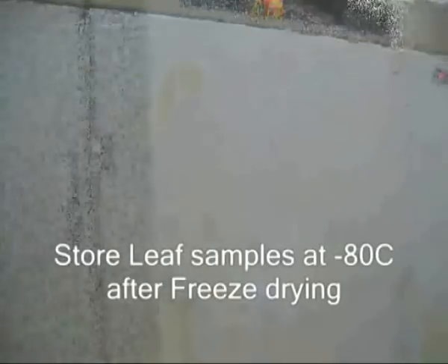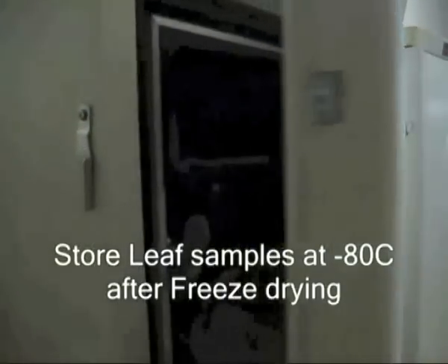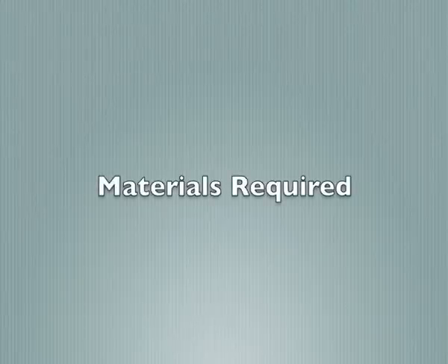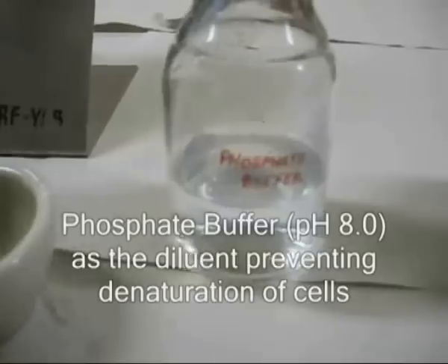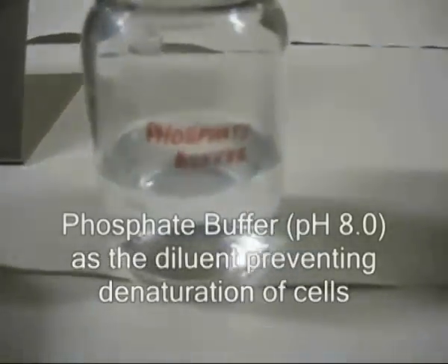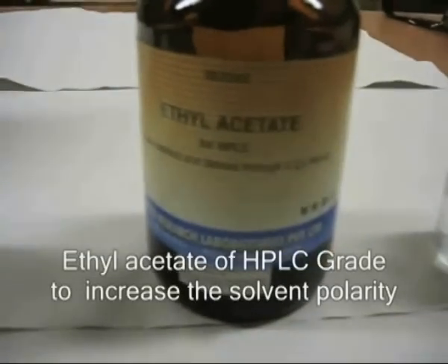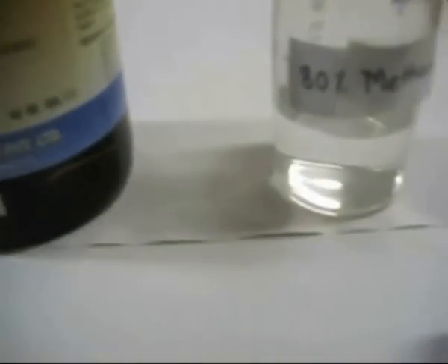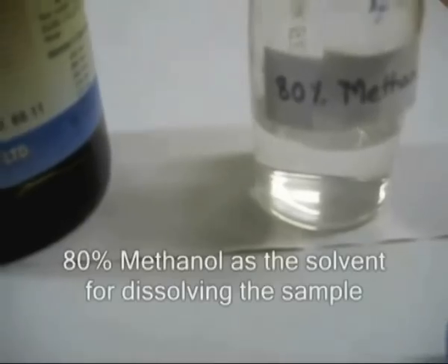Rice leaf samples are stored at minus 80 degrees centigrade after freeze-drying. These are the materials required for sample preparation. Phosphate buffer is the diluent preventing denaturation of cells. Ethyl acetate increases solvent polarity. 80% methanol is the solvent used to dissolve the sample.